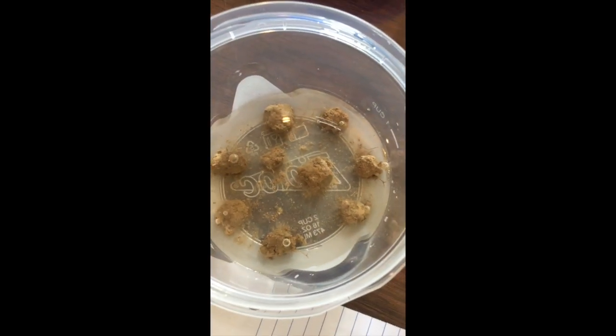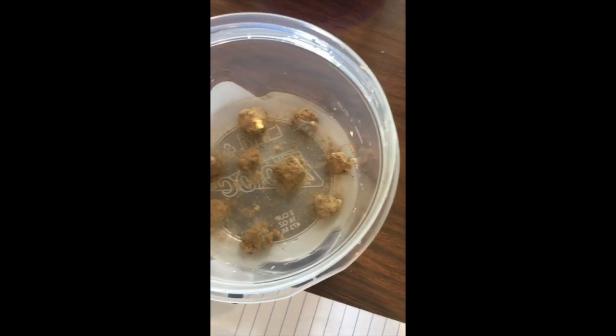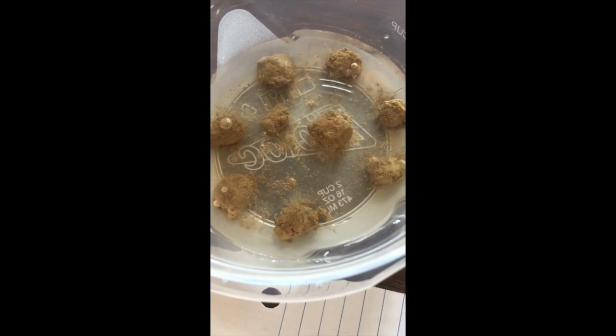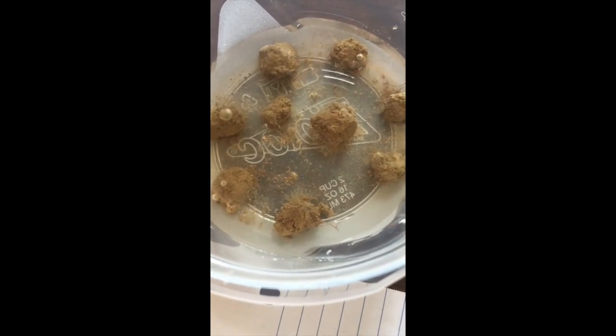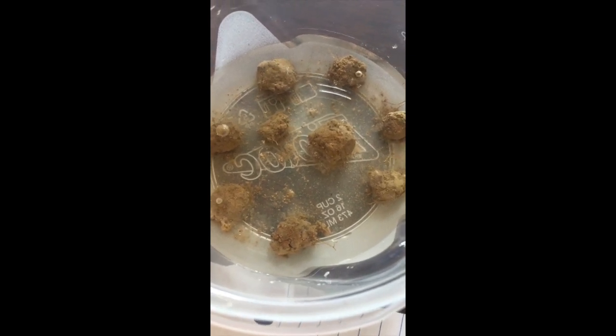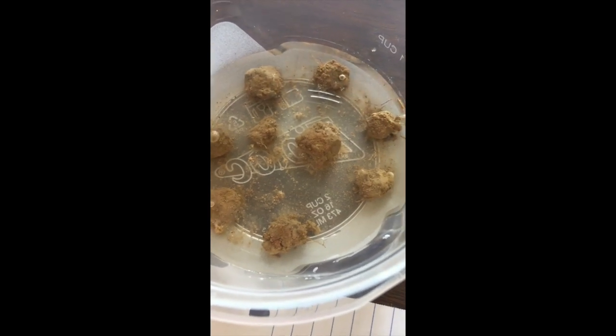So to show you right now, here's my surface and here's my subsoil. There is the field, and there's the forest. I have them barely submerged. For the surface and for the subsoil, there's the field, and there's the forest. All of the aggregates sank. There's some little particles off of them that are kind of floating, but you can kind of tell where part of the soil and other stuff is breaking off fairly easily. And then I'll be back in 2 hours to tell whether the slaking was done or not.